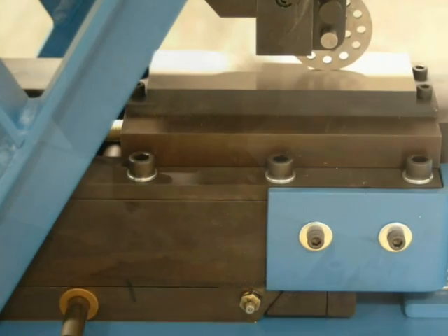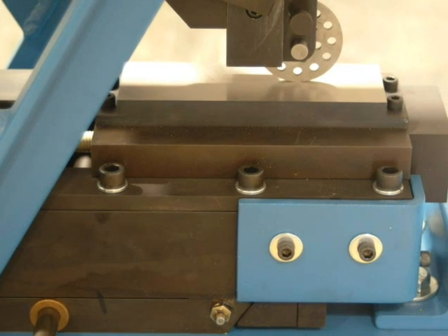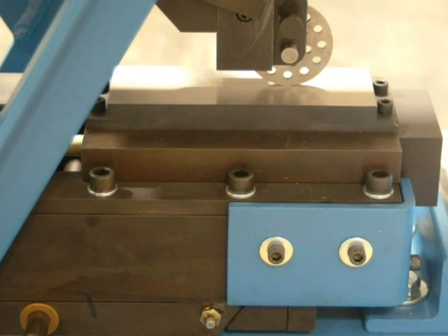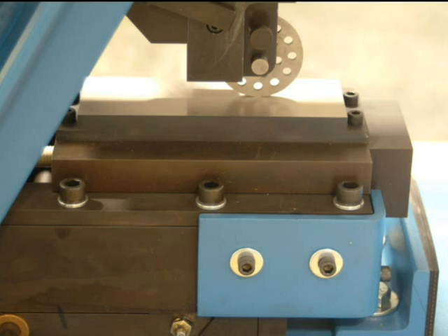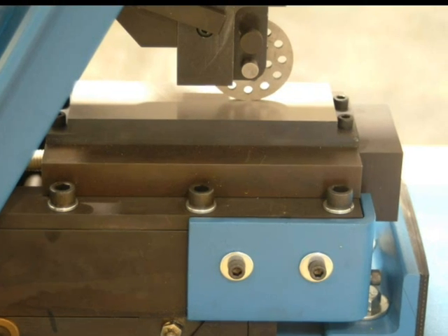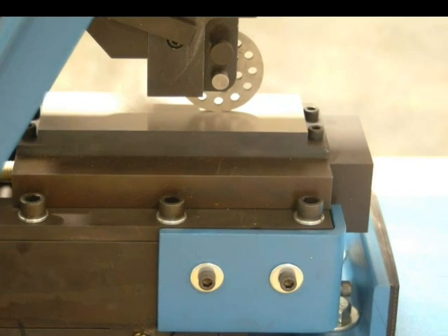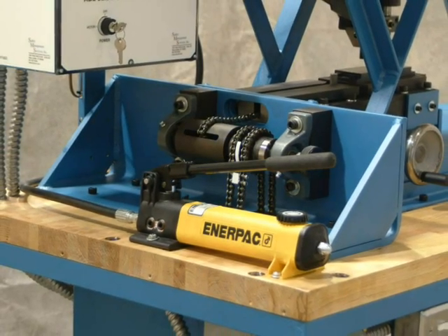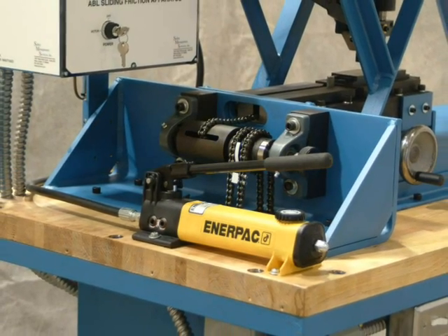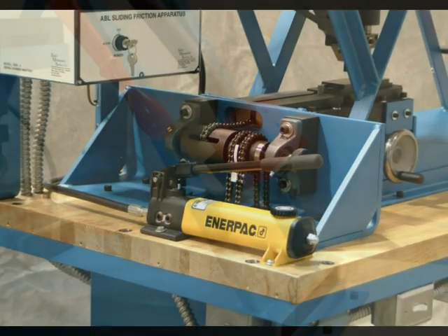A stationary wheel is used to apply an adjustable load to the test material. The sliding anvil then travels at a constant velocity beneath the wheel, subjecting the energetic material to a frictional force. A hydraulic pump is used to increase the pressure that compresses the stationary wheel onto the sliding anvil.